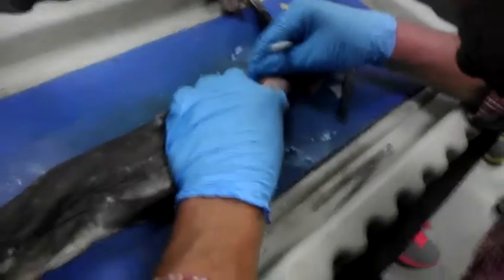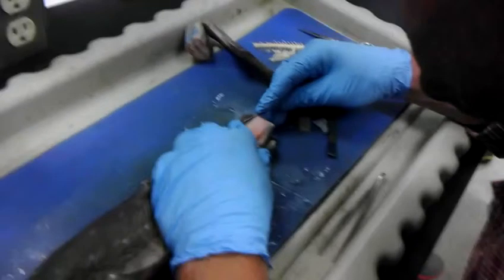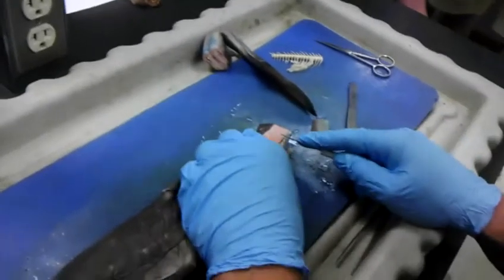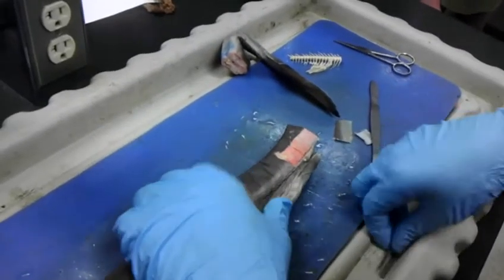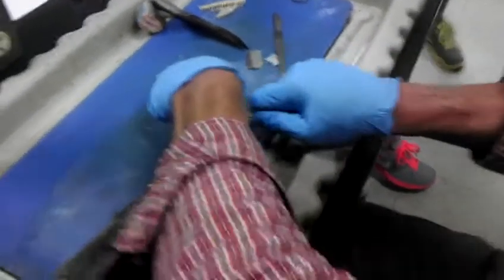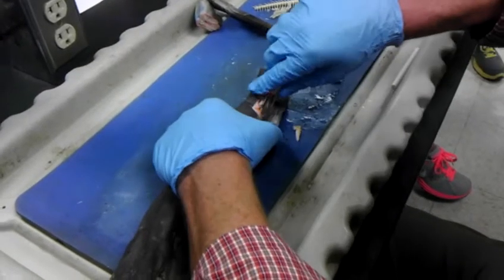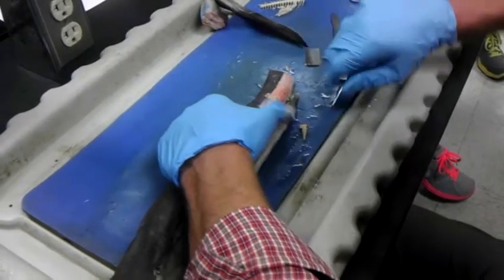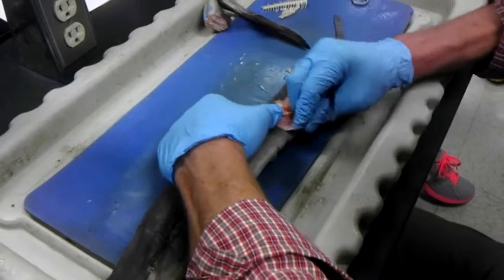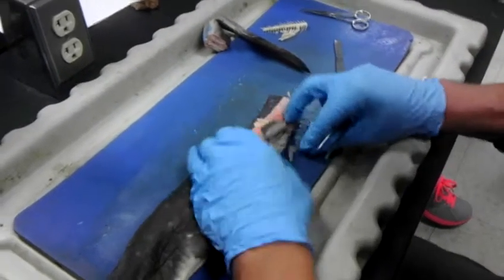And we can split these. Everybody see those segments? It's not the best example. Keep skinning it. See it there? All right.